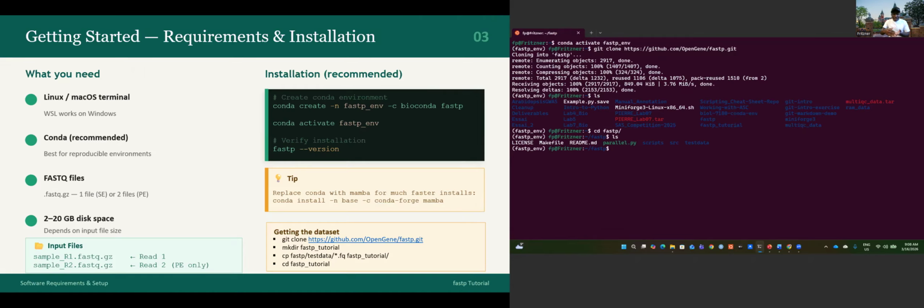You see the license. What we need is the data. It's supposed to be in the test data because this is for the script. Yeah, this is supposed to be it. Let's go inside to see the test data. Voila. Yeah, we have the forward read data and the reverse read data. So let's move back to the home directory.